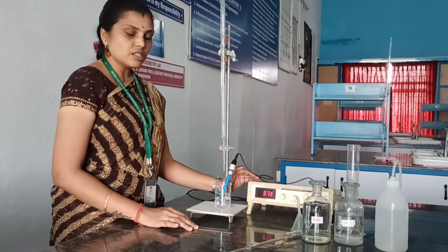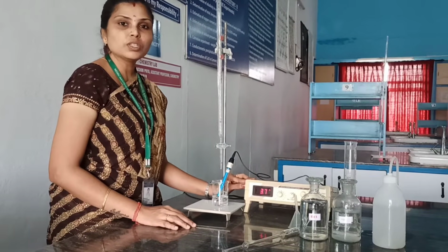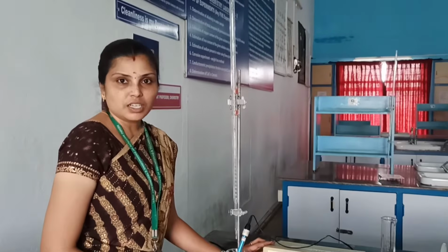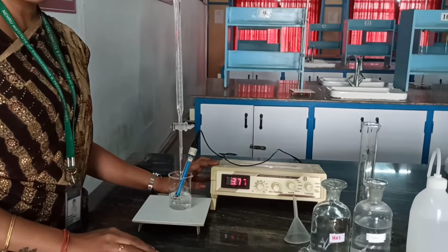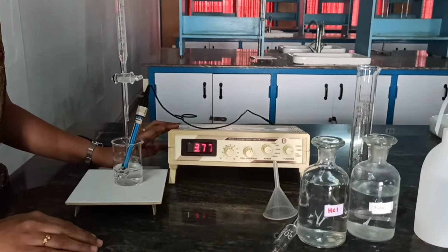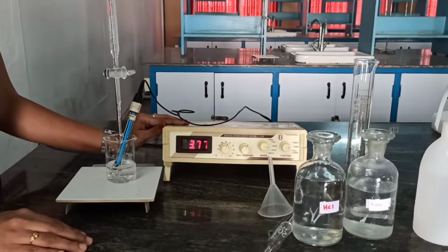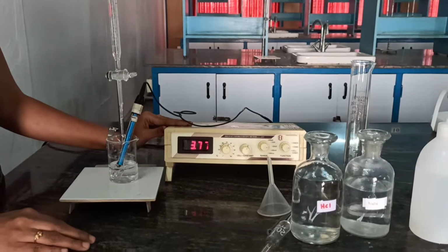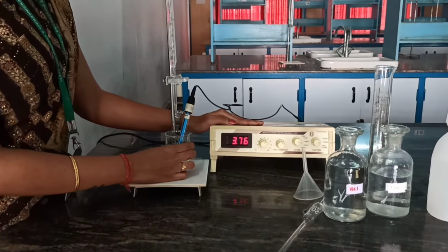So why are we using this electrical experiment? As I told you, this experiment is used to find out the amount of any particular solution having decinormal strength. In normal volumetric analysis we can find out the amount of a solution at higher concentrations, but using this electrical experiment, mainly the conductivity meter, the conductance of any electrolytic solution can be detected by using this conductivity cell, and it can be measured in this conductivity meter.